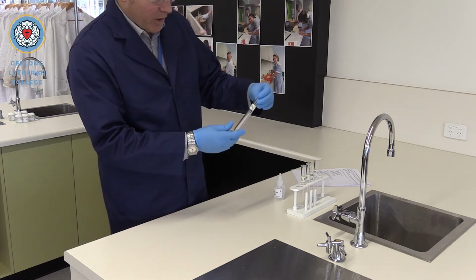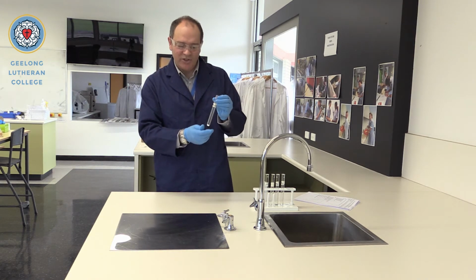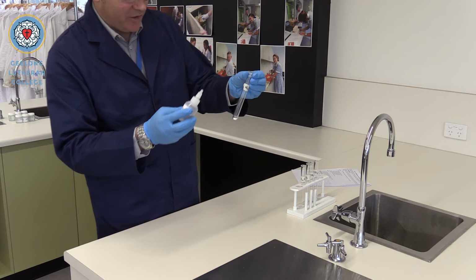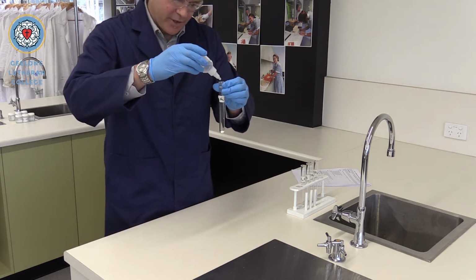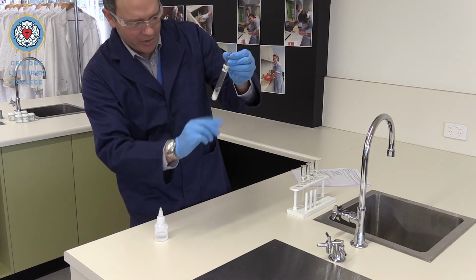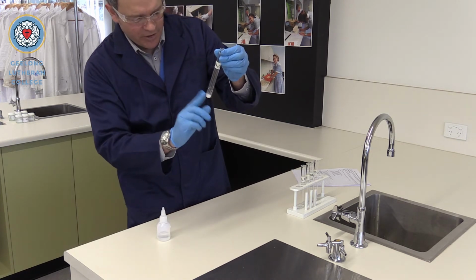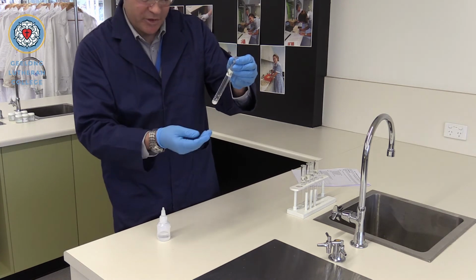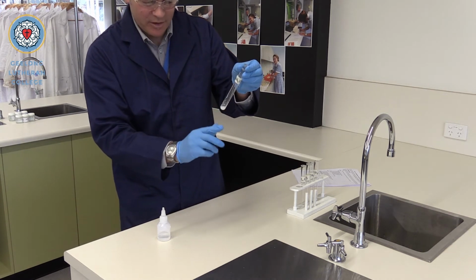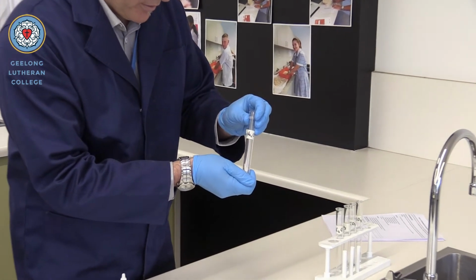Let's get started. So the first compound that we're going to be testing here is sodium carbonate. I'll just be adding a few drops of hydrochloric acid to this mixture and giving it a little tap, and you need to observe straight away. I hope you saw that. Vigorous bubbling there, lots of gas produced, and that gas that's released is carbon dioxide, an odourless, colourless gas.